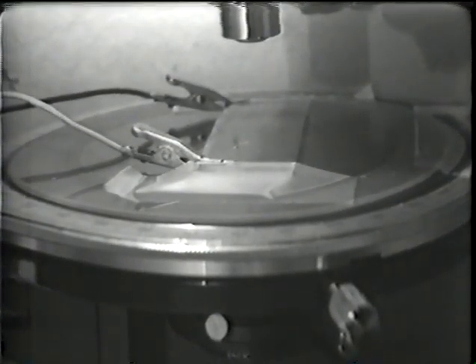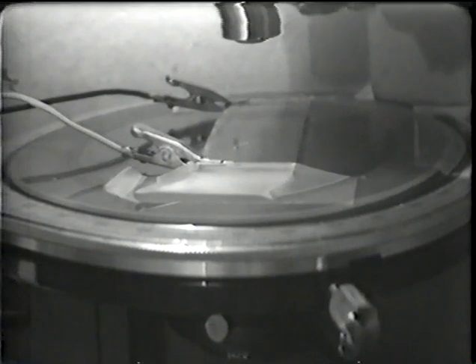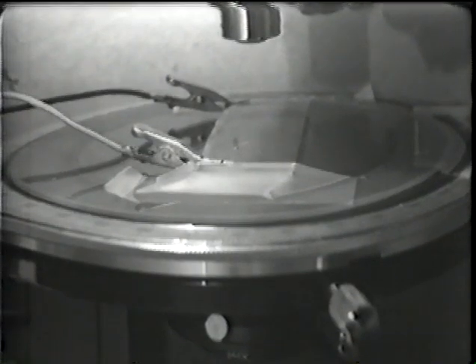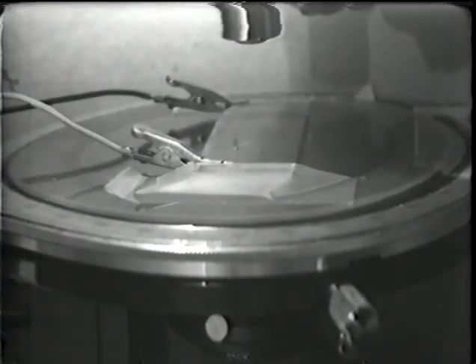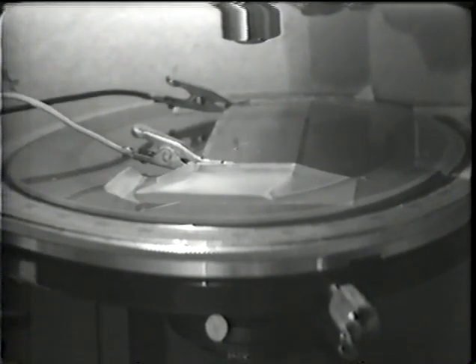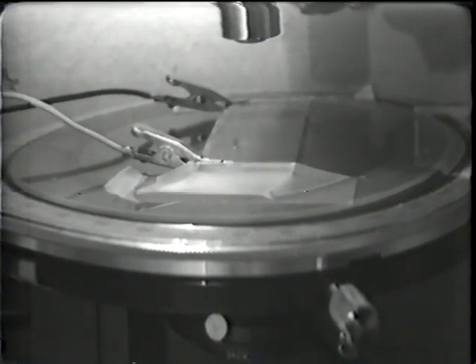At this point, I want to show how polymorphs behave microscopically. We can begin with the preparation of unstable polymorphs. Unstable polymorphs always have higher vapor pressures and higher solubilities, but lower melting points. To prepare unstable polymorphs, the key is supersaturation of the vapor or solution. This is usually done by supercooling, and this applies to the supercooling of the melt as well.